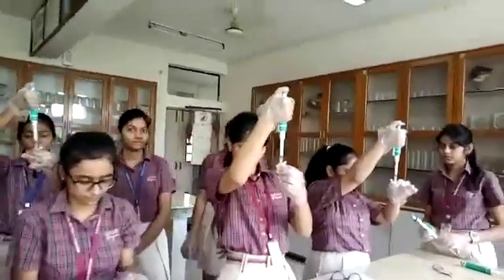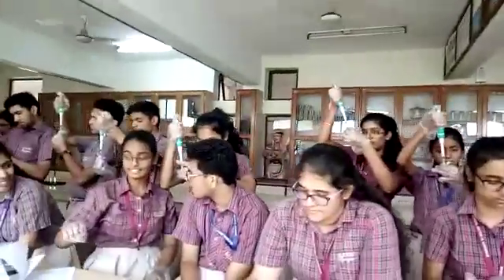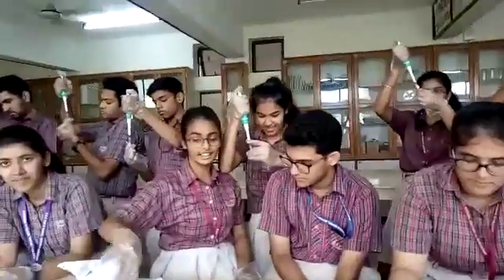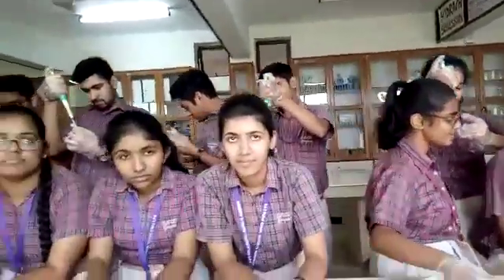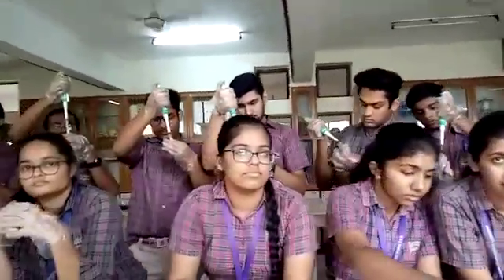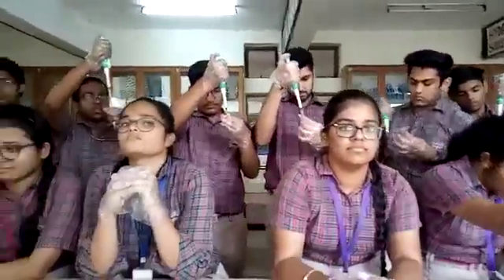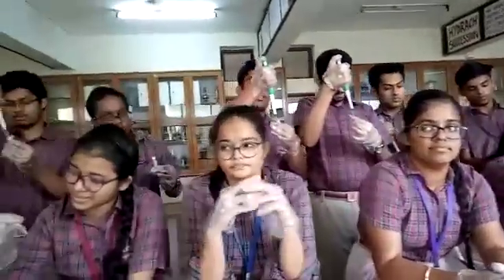Fill it up to nose height, and remember the bubble should be within the limit of the tube. It should not come out of the tube onto your hand — it should stay within the tube. A small bubble is okay, but too much bubble is not allowed.